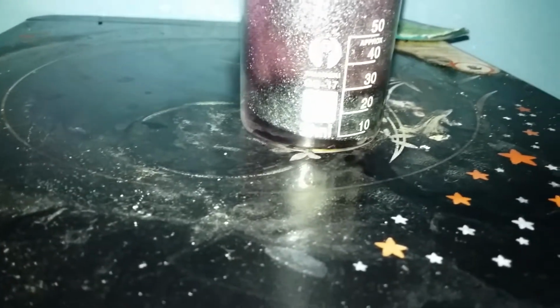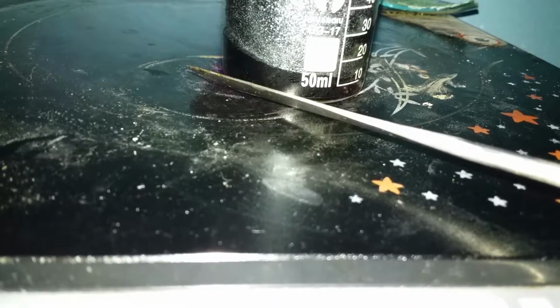Okay, so as you can see, nice crystals are forming, and now at this bottom, wait, let me rotate it. Okay, so you can see, wait, let me point it. See there, we have, what? We are leaking. My god. Okay, so basically we have a crack. So there you can see molten iodine. Molten iodine is right here, see? So at elevated temperatures it just sublimes, and at the same time it melts. Okay, that's it. I'm gonna check in when it's all done.